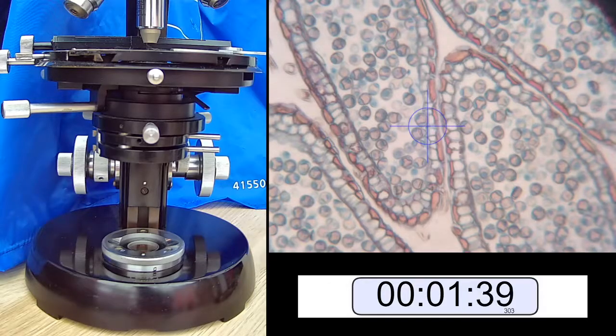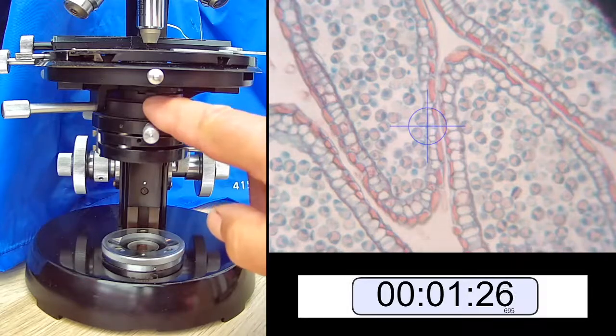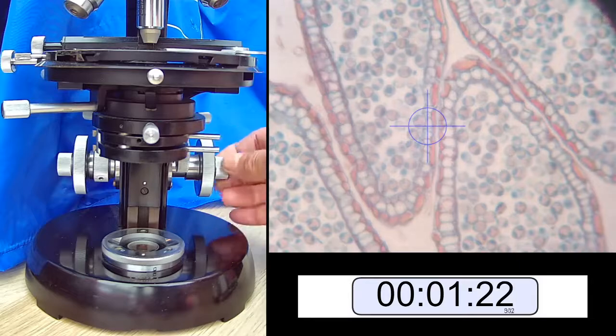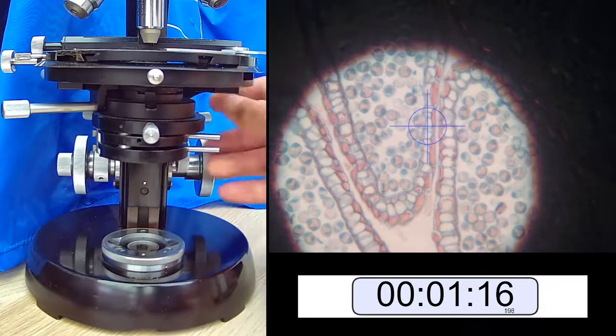So Köhler Illumination lets us set the microscope correctly for the illumination. We want to look at the field aperture. We want to look at the condenser. We want to look at the condenser aperture up here. And what we do, we pop a slide on the microscope, focus the slide. When the slide's focused, we can close the field aperture and get that into focus.